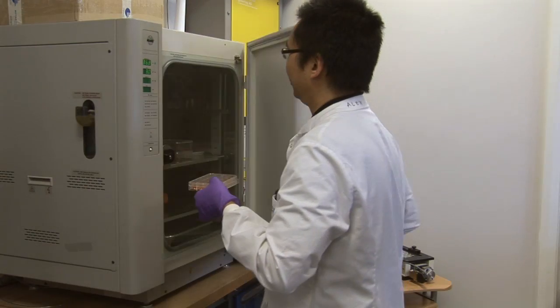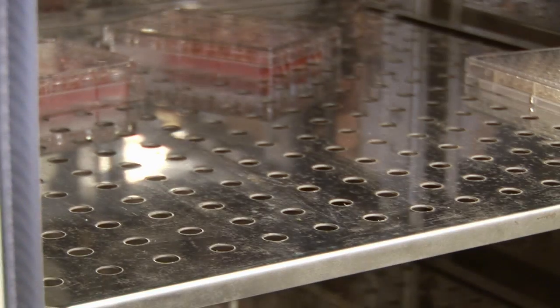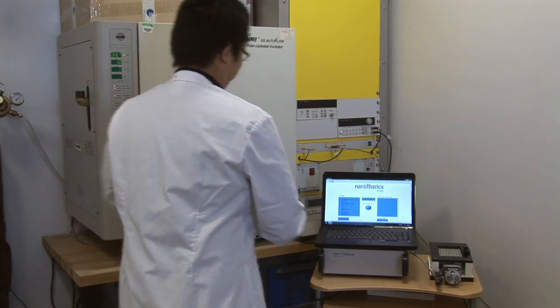Cells are seeded in a standard tissue culture plate 24 hours before the experiment. Cells are manipulated in a sterile environment.